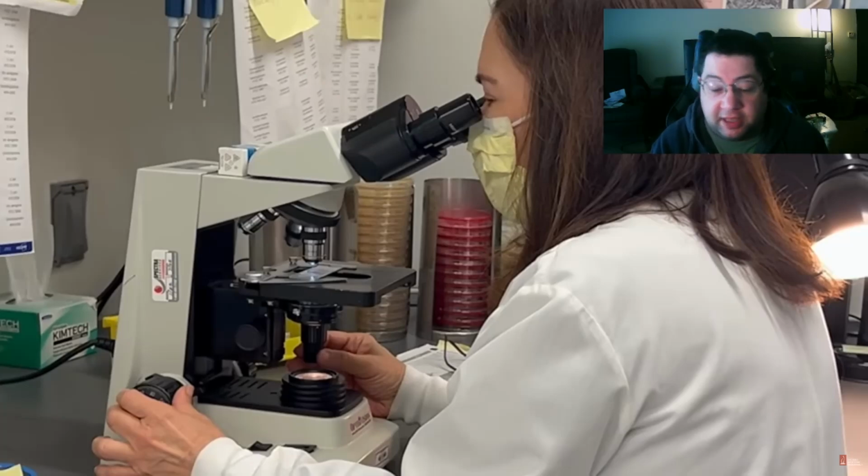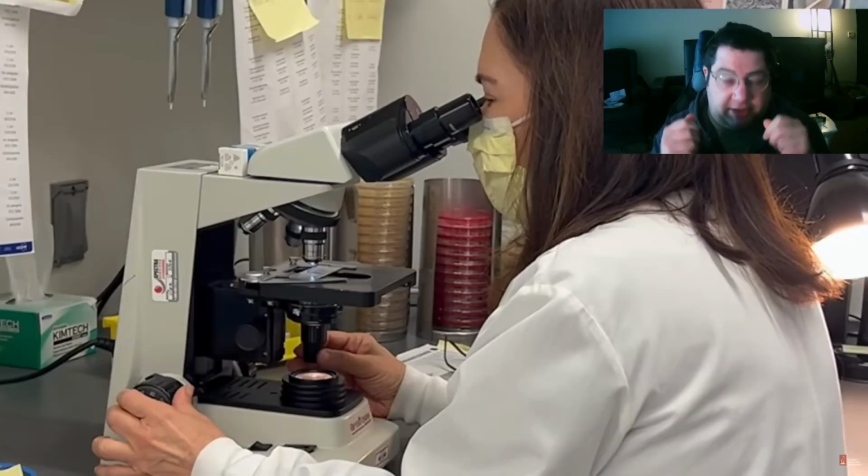And then what you typically do is take a piece of tape, gently press it on top of the growth, transfer it to a slide, and then you will have a drop of a dye called lactophenol blue, which is a very specific dye for fungus and mold. Then you'll put a glass slip over that, and that's how you can read it under the microscope. Again, a lot of tech time.